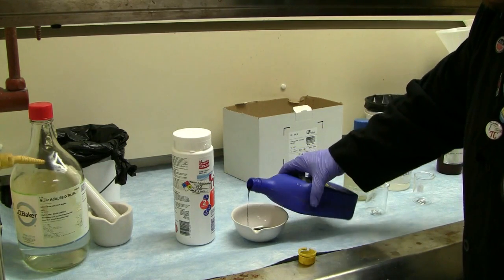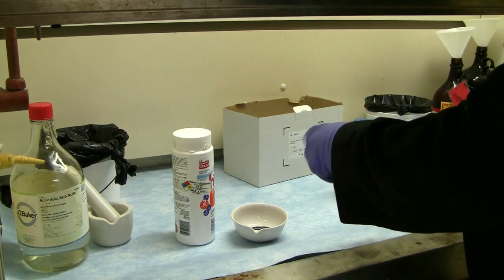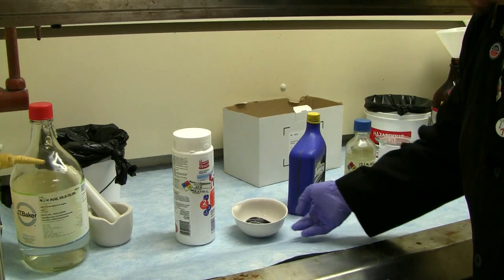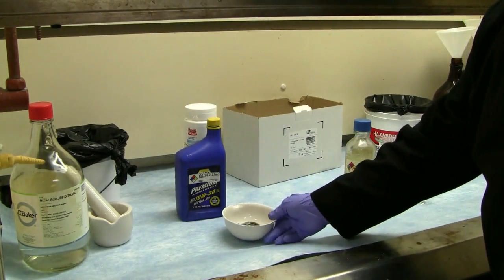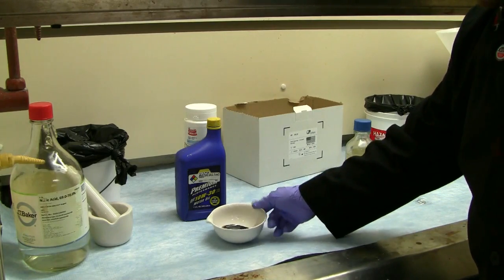Now this is used motor oil, because I like to recycle whenever possible. And we're going to let that cook for a little bit. So as that's going, whenever it really starts kicking off, you'll see the reaction, and it should make a nice little cake, along with potential flame.